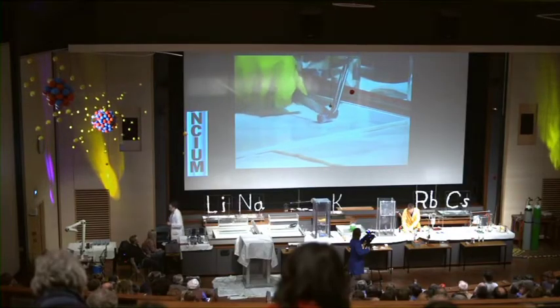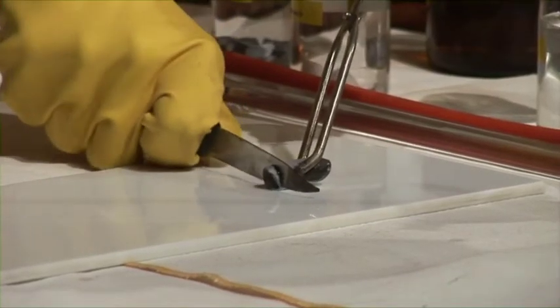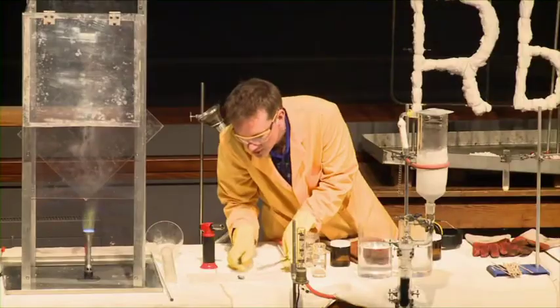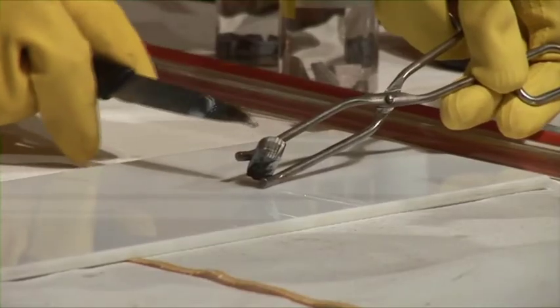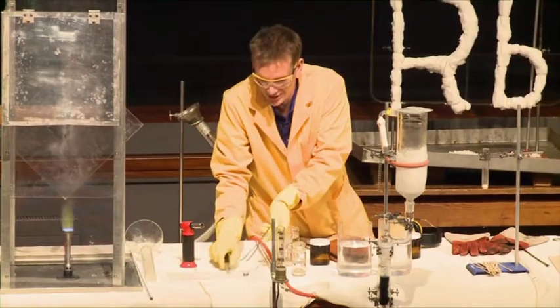If I cut it — and it's rather hard to cut — I can cut it with a knife here. It's pretty hard. And you see that initially it's very, very shiny. This shiny surface of the lithium will eventually tarnish and go black, and it's beginning to change already, as it's reacting with the gases in the air.